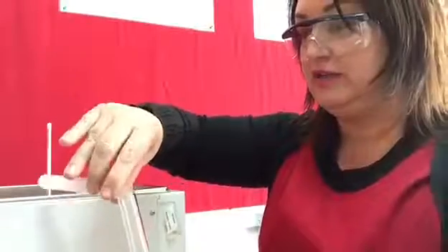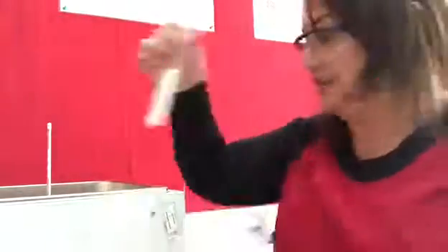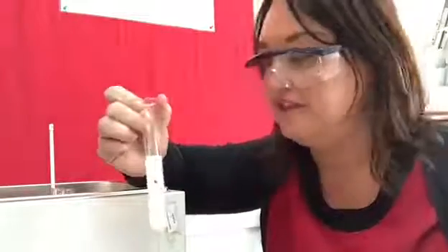I'm pouring the solution into the larger tube, making sure it covers my cross. I've adjusted my crosses and moved them further down the tube so when I add the solution the cross is completely covered. It's very difficult to put your cross on a wet tube, so it's better to do them all at the same time when they're dry.